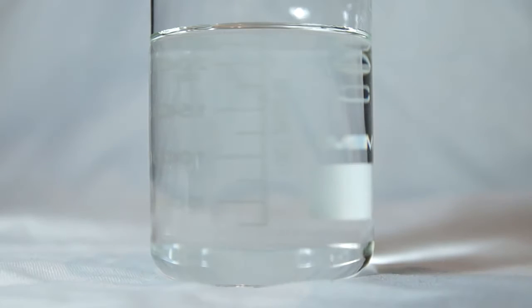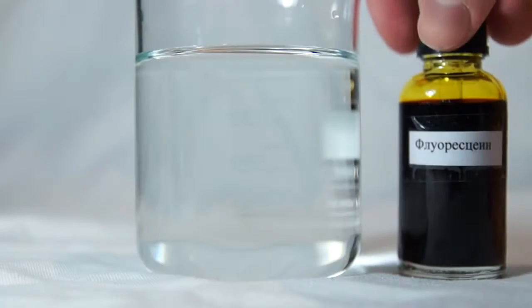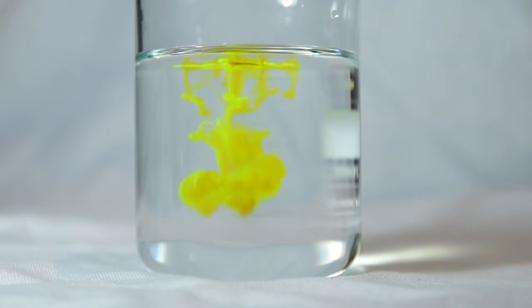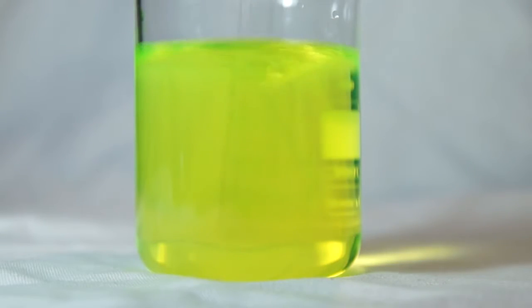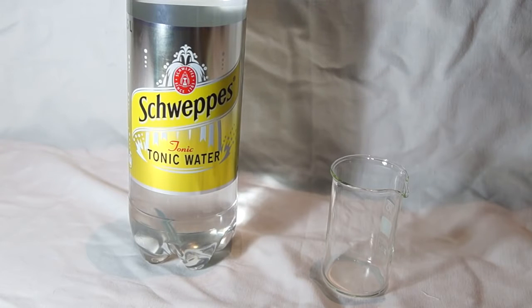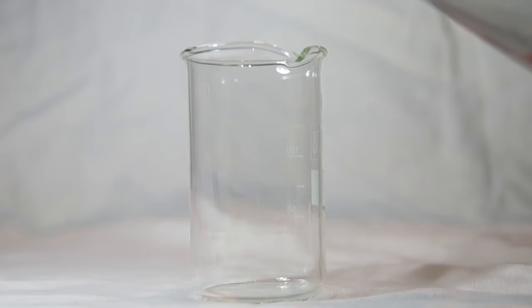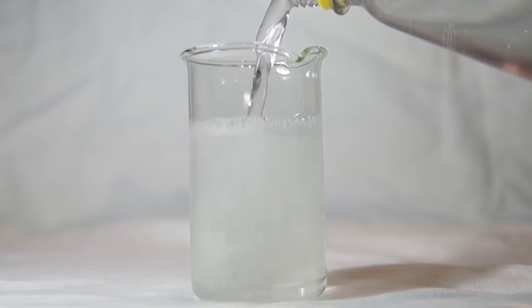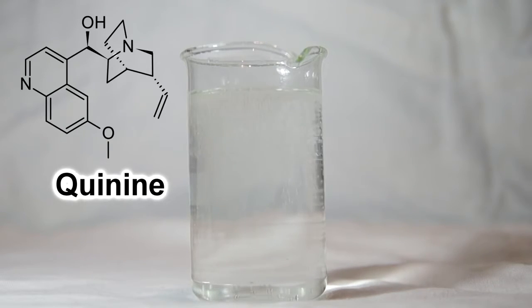Let's prepare the dilute solutions of fluorophores. I'll take the beakers with water and add a drop of each substance to each of them. Each solution has such a bright green color. Another substance will illuminate blue — this substance is sold in many stores and it's called tonic water. I bought a usual Schweppes in a store, and this drink contains quinine that glows in ultraviolet light.